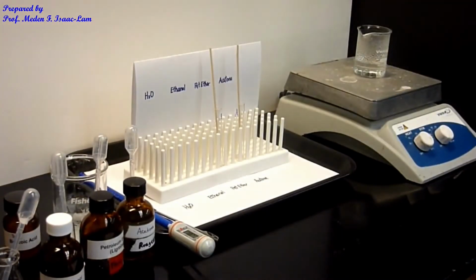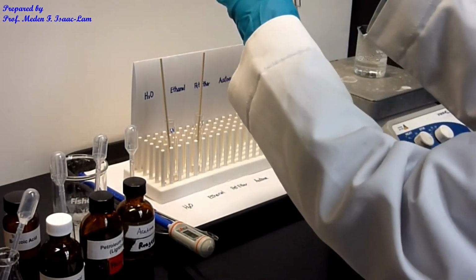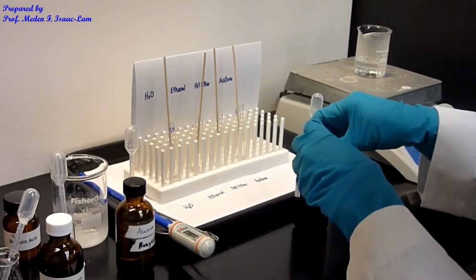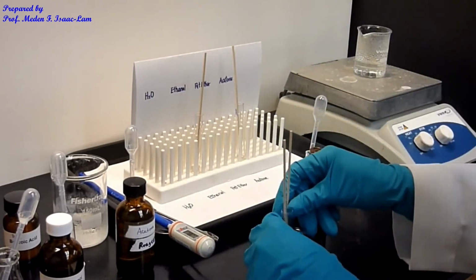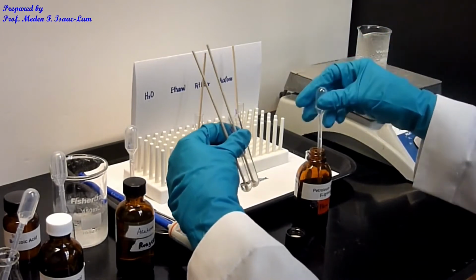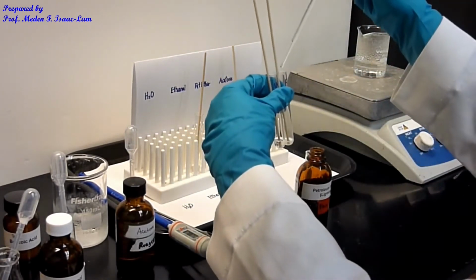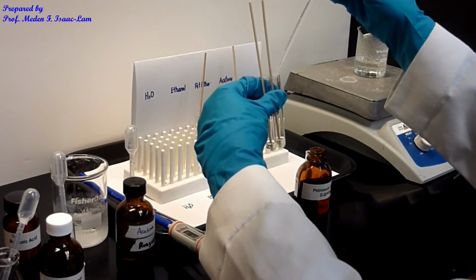So now let's do the petroleum ether and then acetone. So again, the petroleum ether is volatile. Organic solvents typically are more volatile than your water. So I'm going to make it the same amount as the water, so I can make a comparison. So on my left is water, W, and then petroleum ether on my right, P.